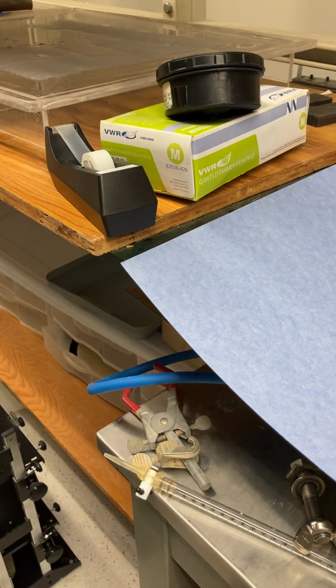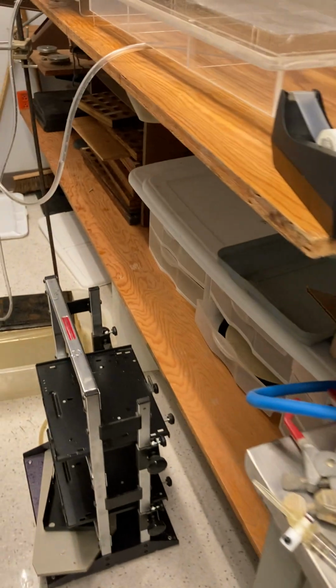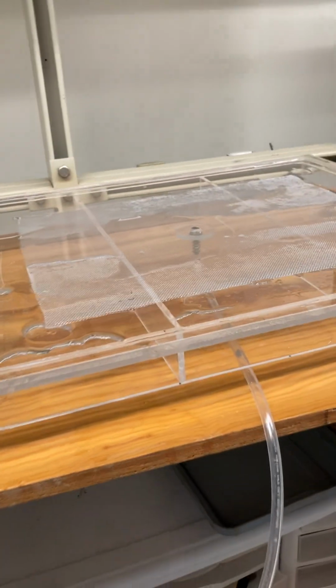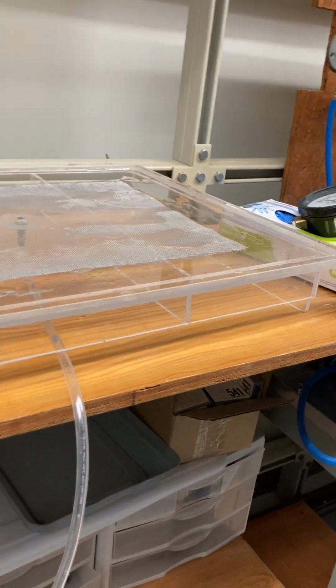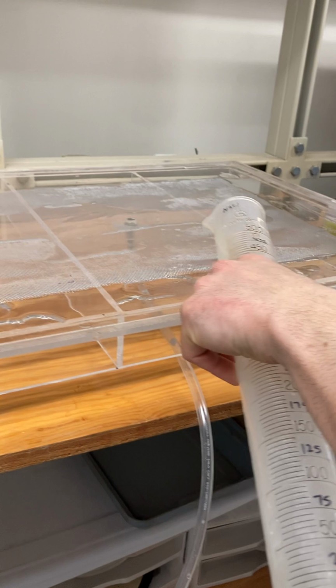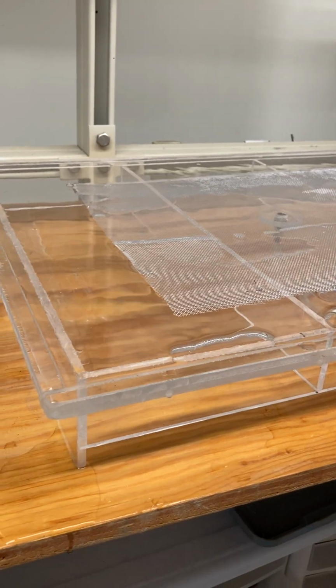Do we do the roller? We're gonna add some more water first. Again, the important thing is getting the water ponded on the top. The more air you can get rid of now, the easier it is later. All right. See how this fills up almost all the way to the edge.